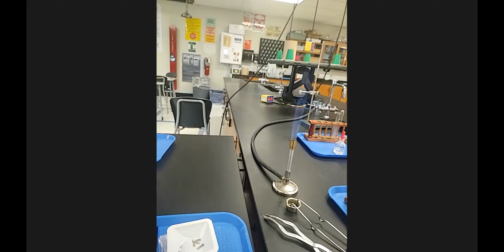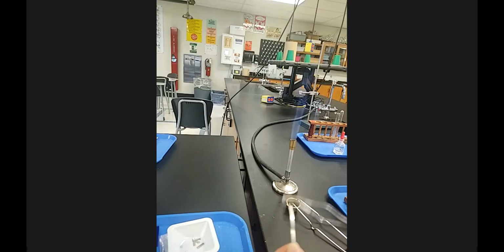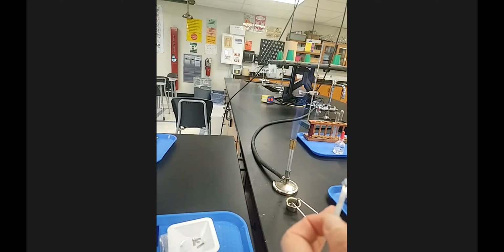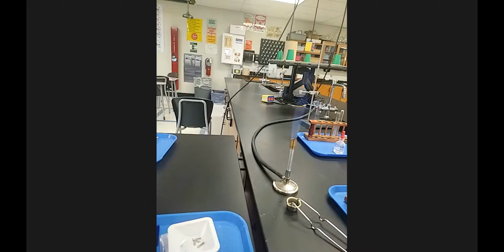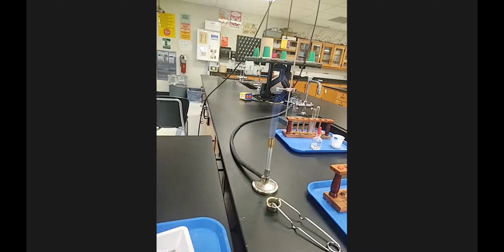flaky substance. Now this big piece of magnesium, I'm going to put my tongs in as well. And it'll look really similar at first, but at the very end, we're going to see another color that magnesium gives off that you can only see when you look at it through cobalt glass.